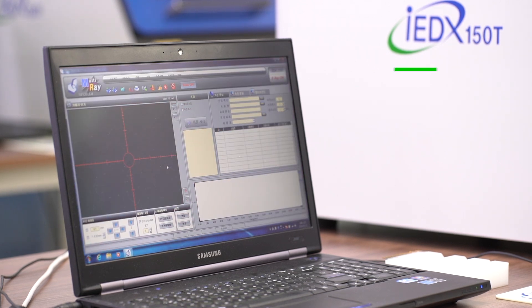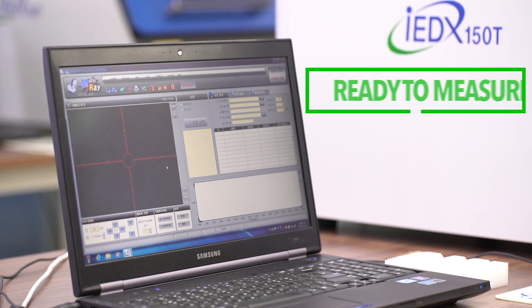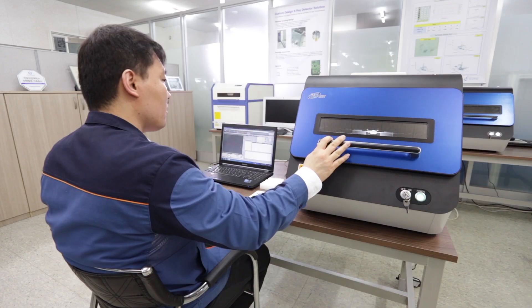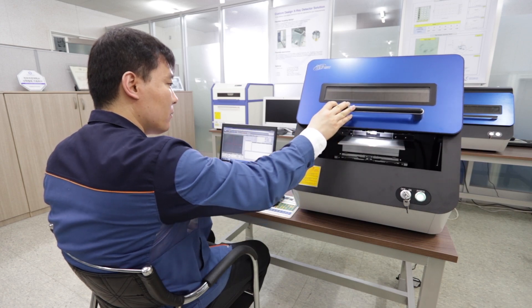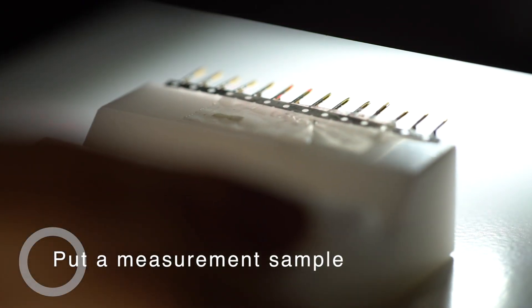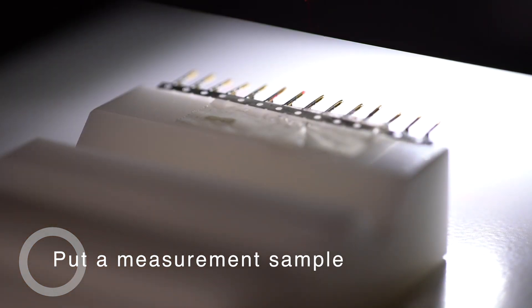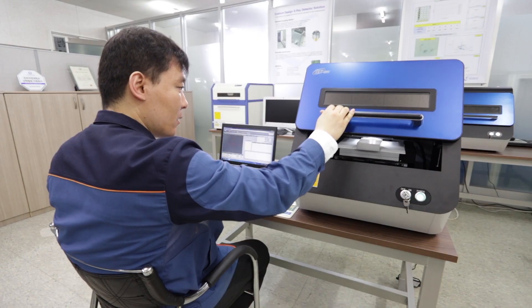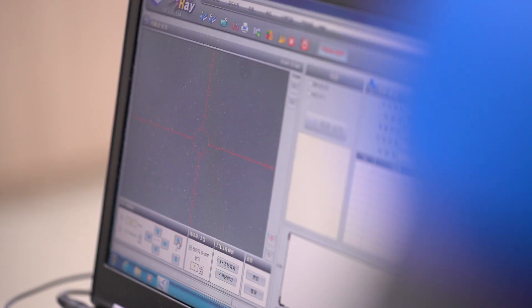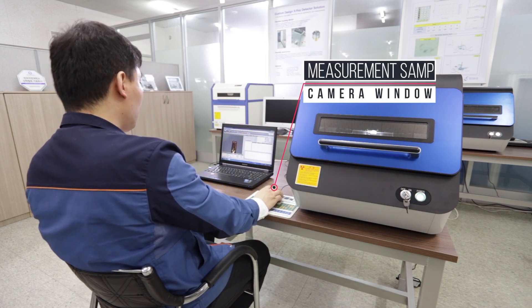Now we're ready to make the measurements. Open the door and put the sample in. Please close the door. You will see a sample in the camera window.